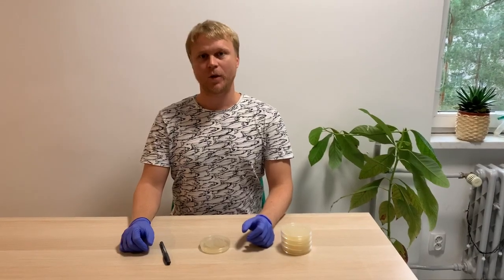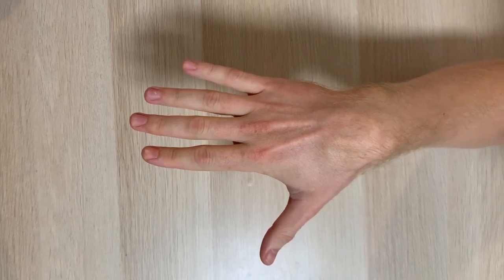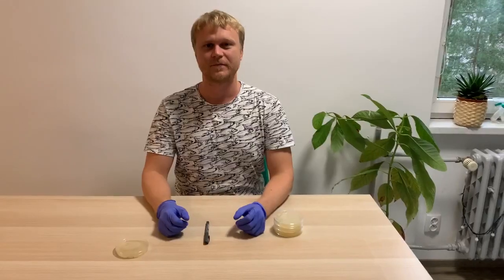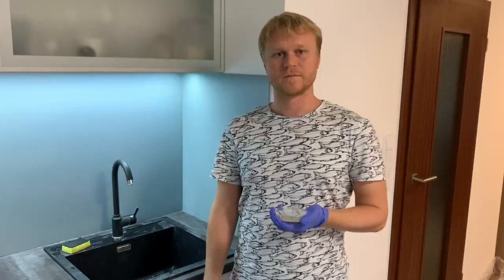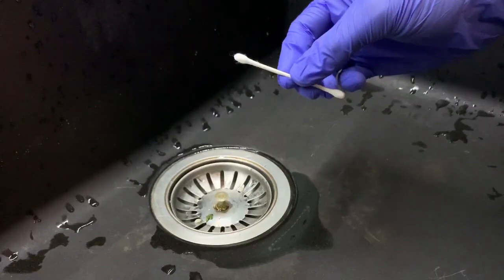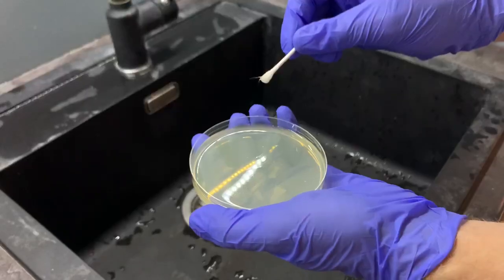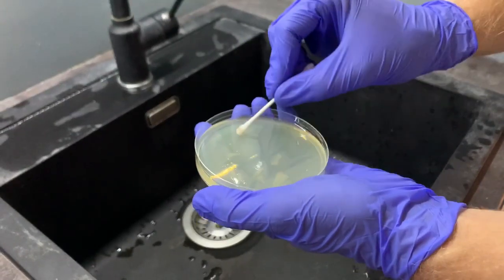We recommend to study the following sampling sites. Use a marker to label your petri dish. We will start from hands — a lot of different bacteria live on our skin, but some of them are just occasional travelers. Other sampling sites you can easily find around you. Let's start from the kitchen. You can choose any surface you like, but the sink must be full of bacteria. Use a cotton swab to scrub your sink, especially near the wet drain. Very gently transfer the bacteria with an exact movement onto the agar plate.